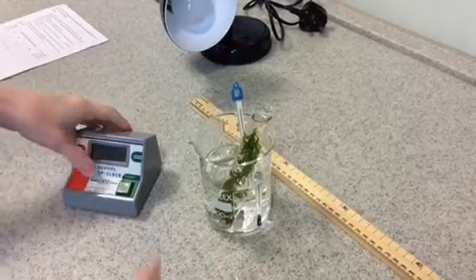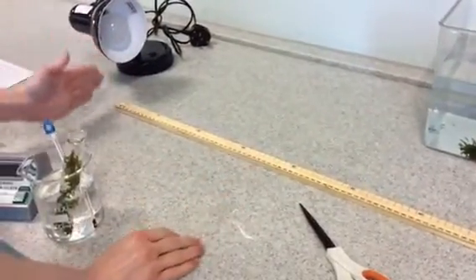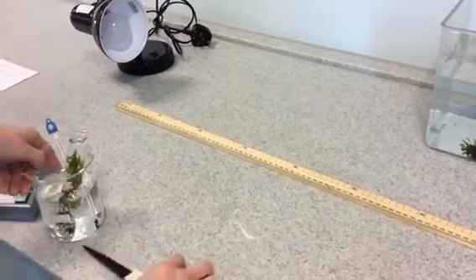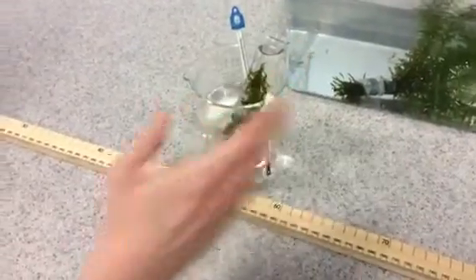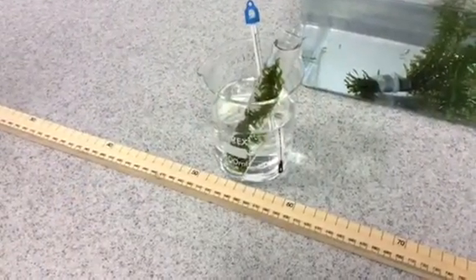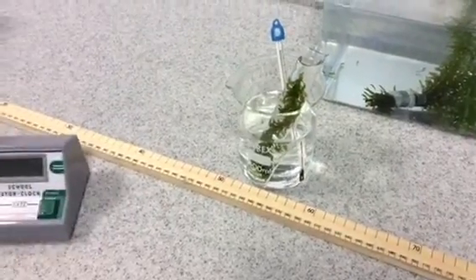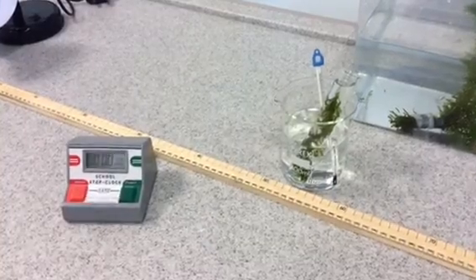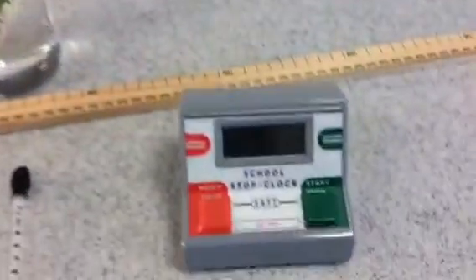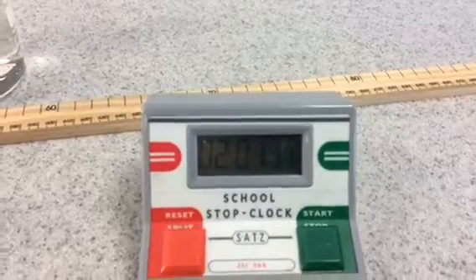Now what I want you to do is take your meter ruler at 0 centimetres in line with the lamp, and I want you to place your pondweed starting at 50 centimetres, so the edge of your beaker on 50 centimetres away from the lamp, and switch your lamp on, and I'd like you to leave your pondweed where it is for 2 minutes and do nothing. And I've got one of those set up. So this has been at 50 centimetres, bubbling away for 2 minutes.